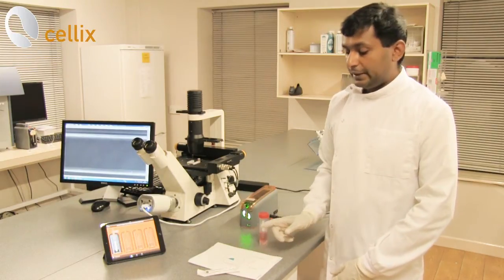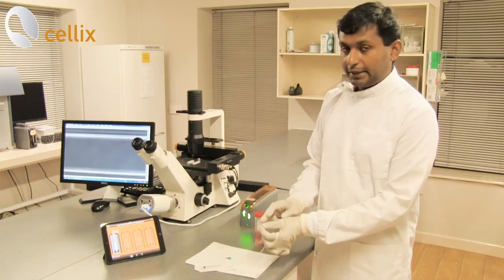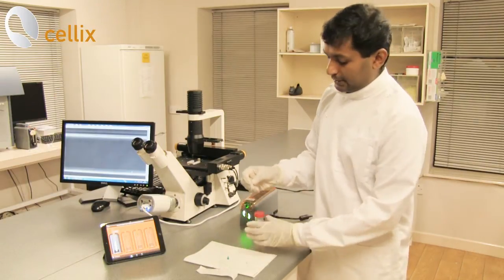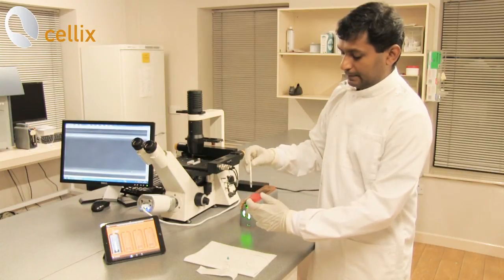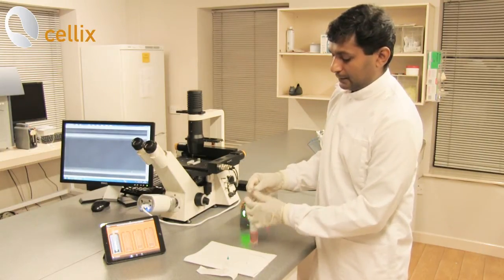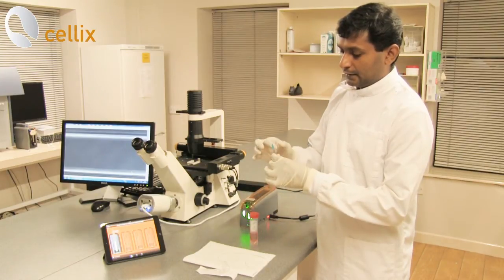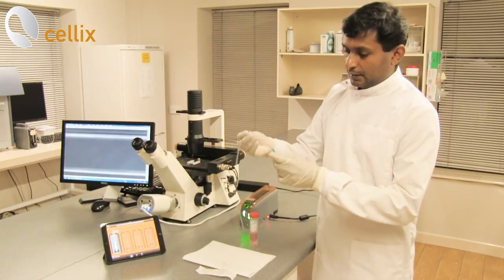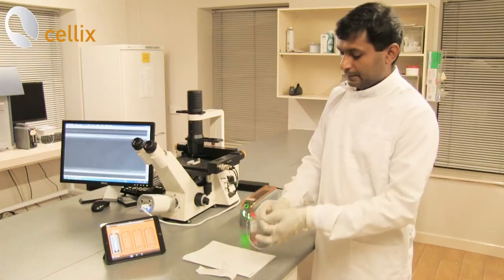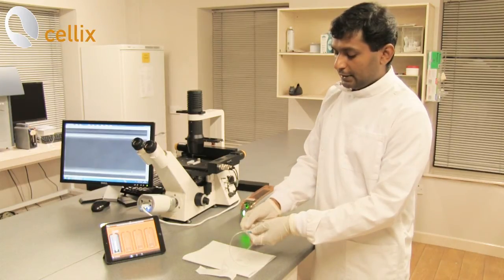Next is to pre-fill the syringe with the media. For that we have a 1ml syringe, media, a tube with a pin at one end and a connector at the other end. Take the syringe, connect the blue connector, remove the bubbles, connect the tubing, and flush the media to fill the tubing. You can see the liquid on the other side.